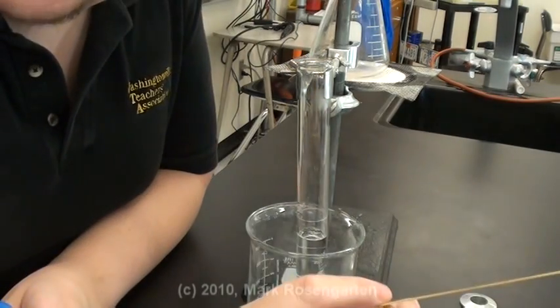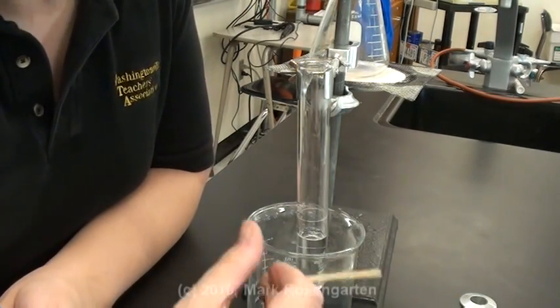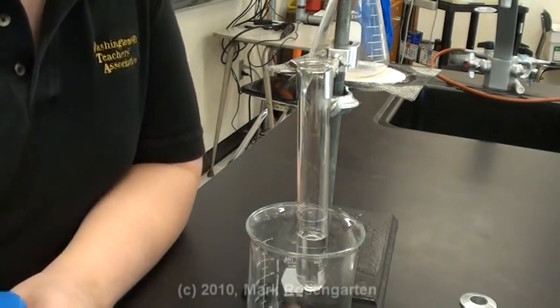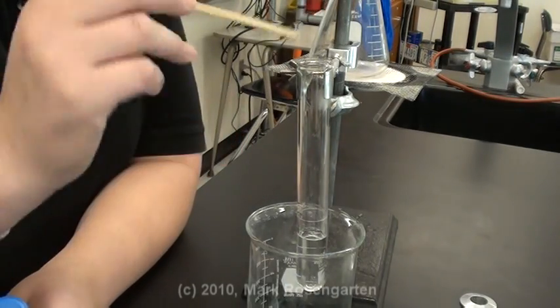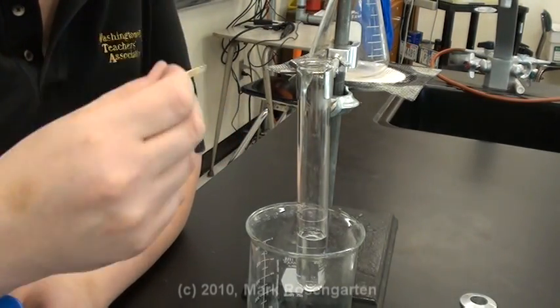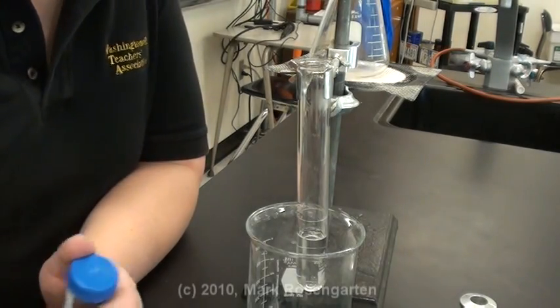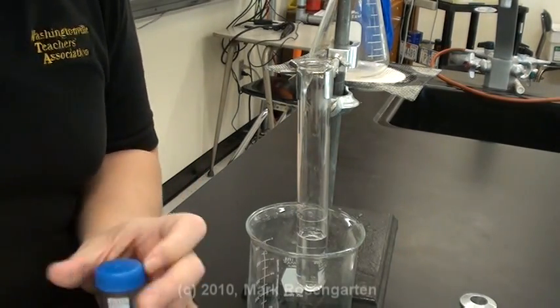Now, if it just continues to be out, there's carbon dioxide in there. If it explodes, it's hydrogen. On the other hand, if it catches fire again, that's because there's an excess of oxygen. That oxygen reignites the flame. Those are your three classic flame tests.